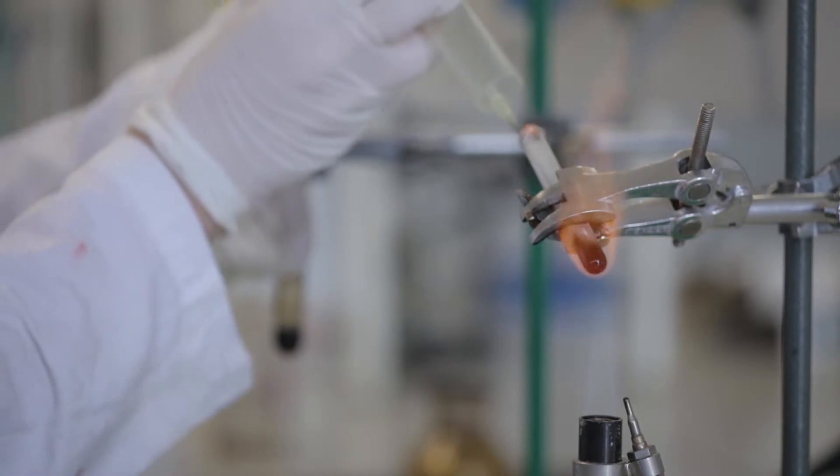As the sodium begins to melt and glow, the cannula with the chlorine gas is transferred with a syringe to the test tube with the molten sodium.